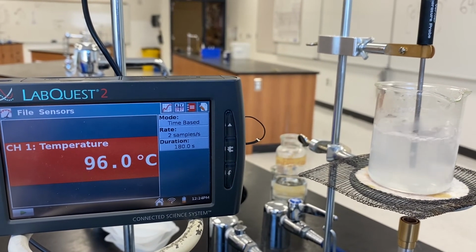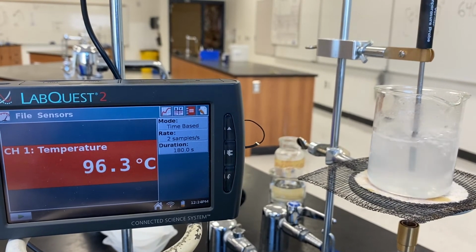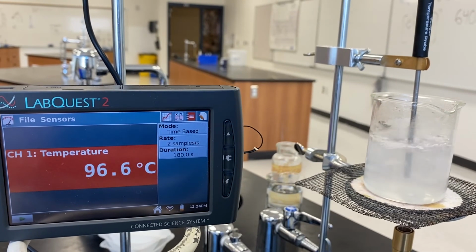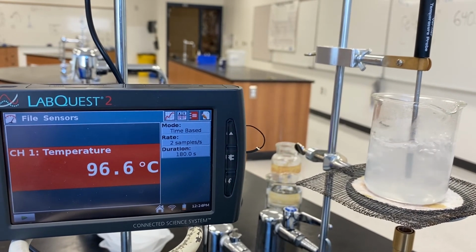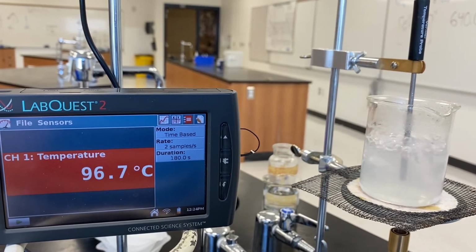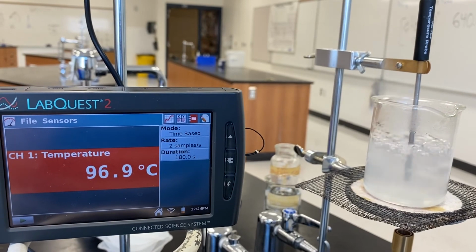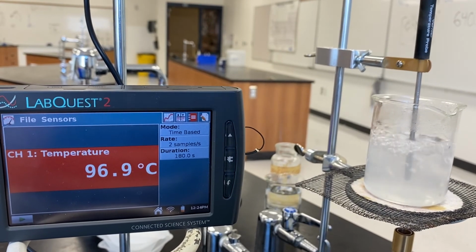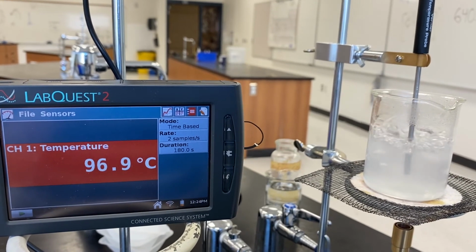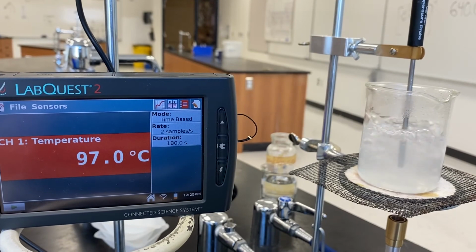It's interesting how this first jump was 8 tenths, and then it's been 4 tenths from there. That's what I was just looking at. It's so interesting. Because it should be linear. Right. Let's see if this hits 97. Oh, look. Do it. Do it. Yes.